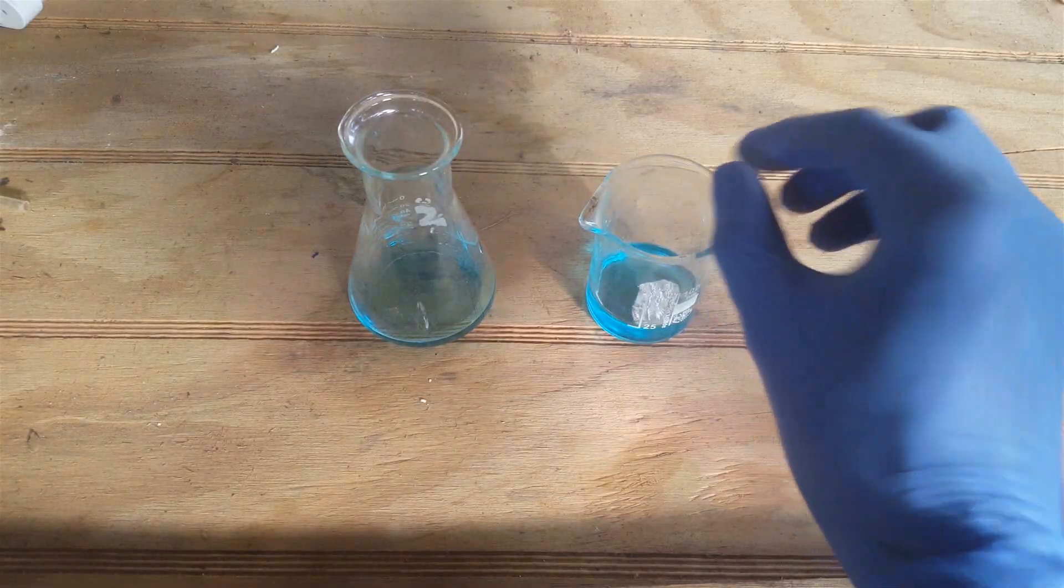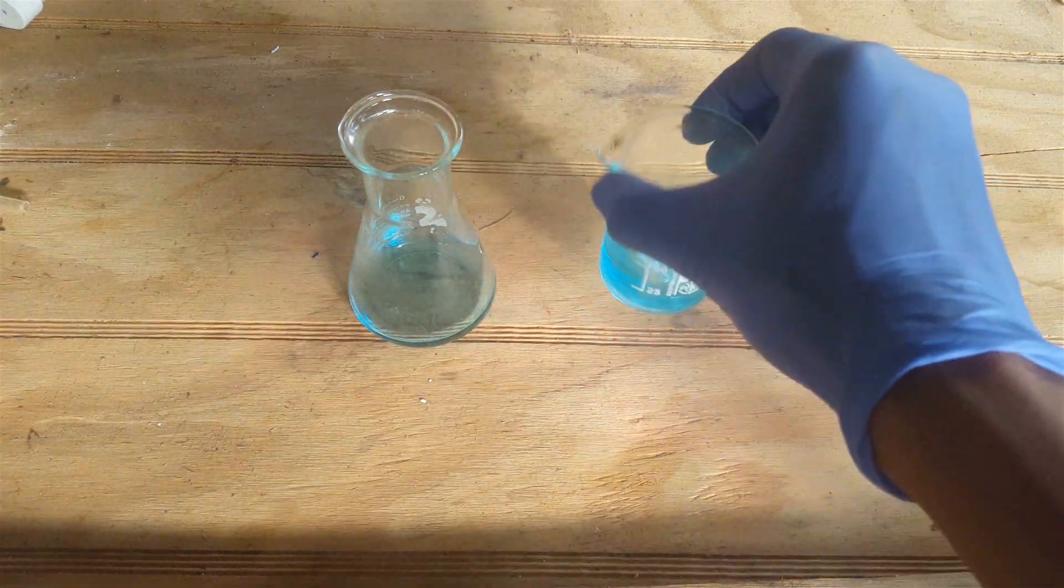Add in a piece of aluminum foil to the beaker. Just some gentle swirling to get things going.